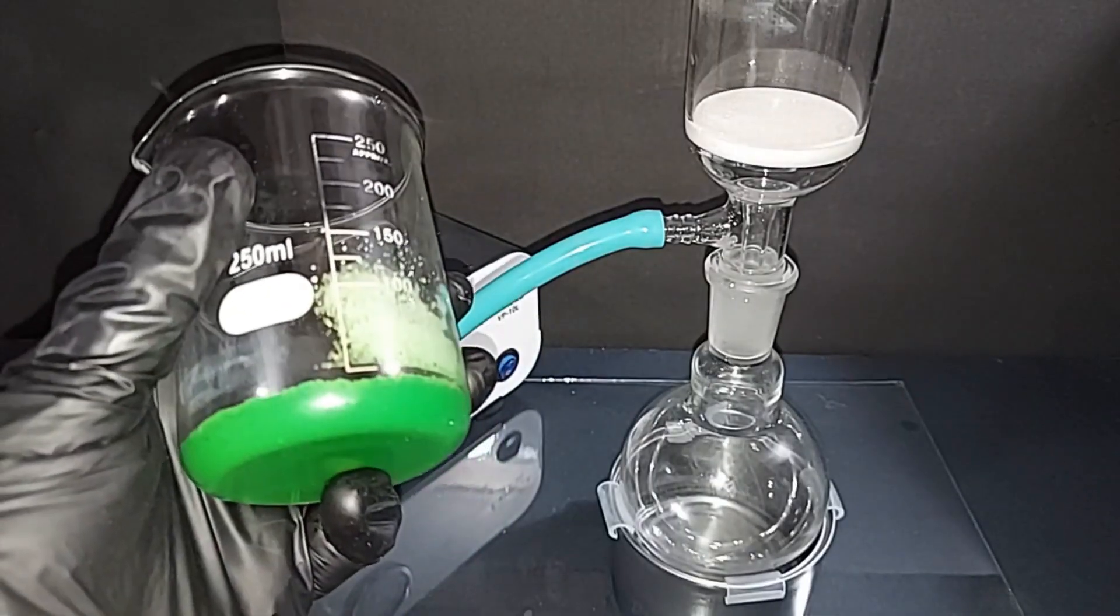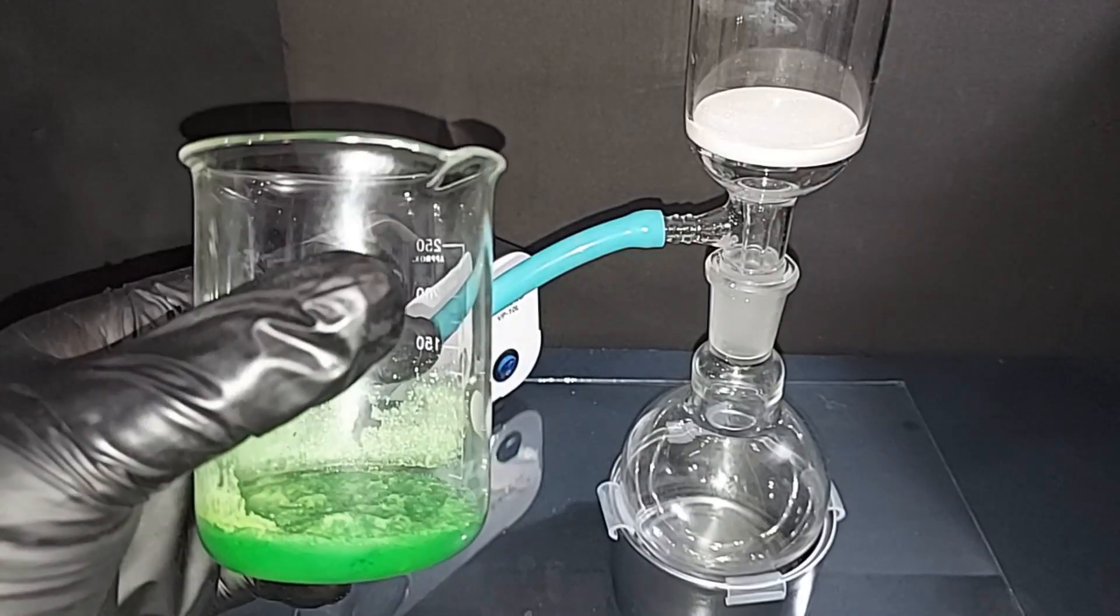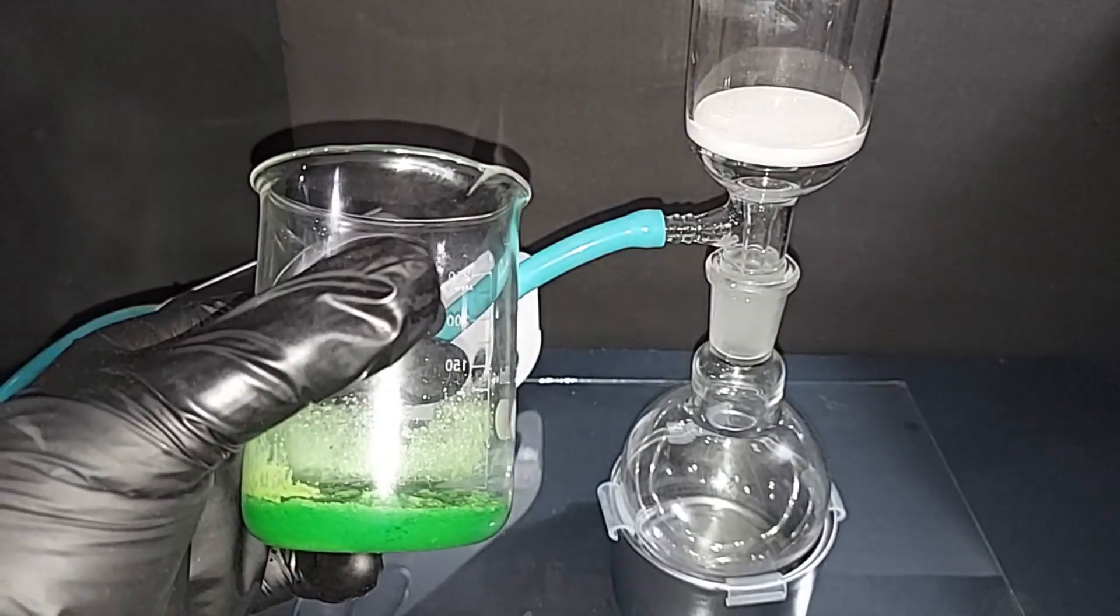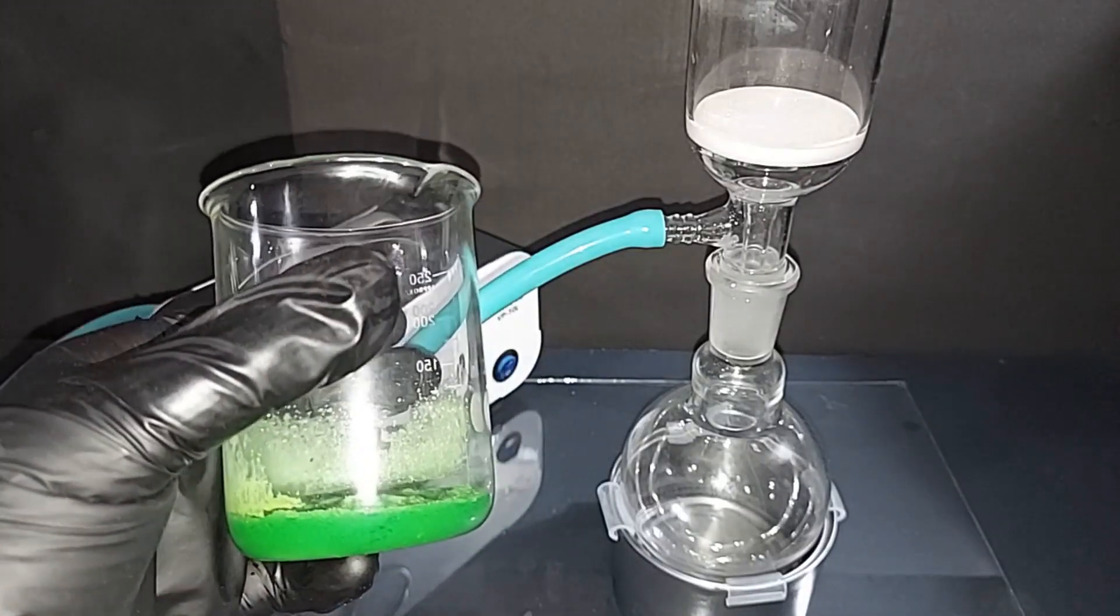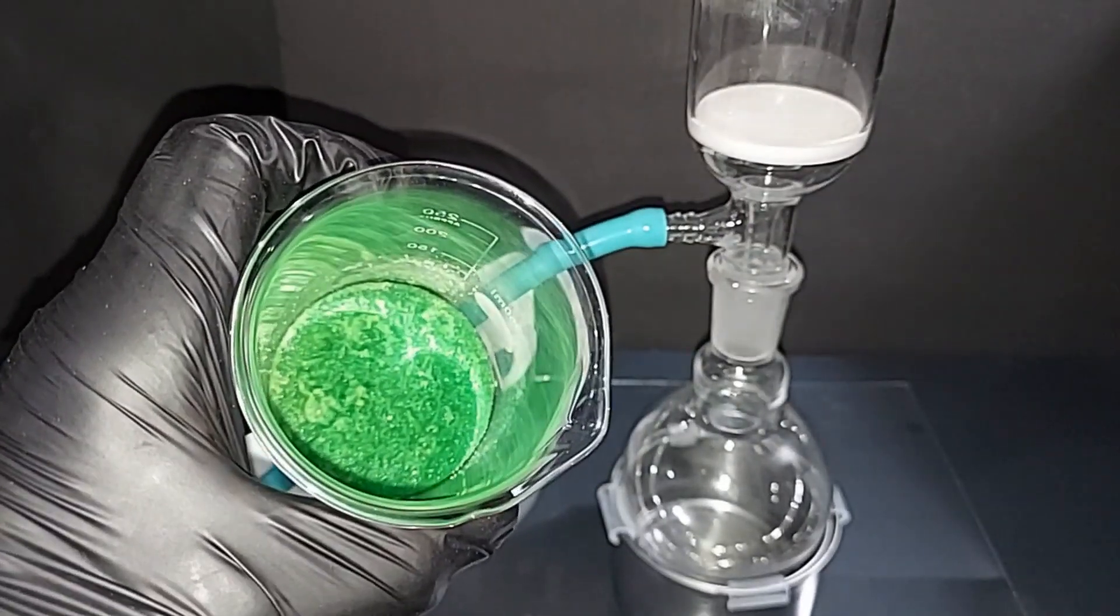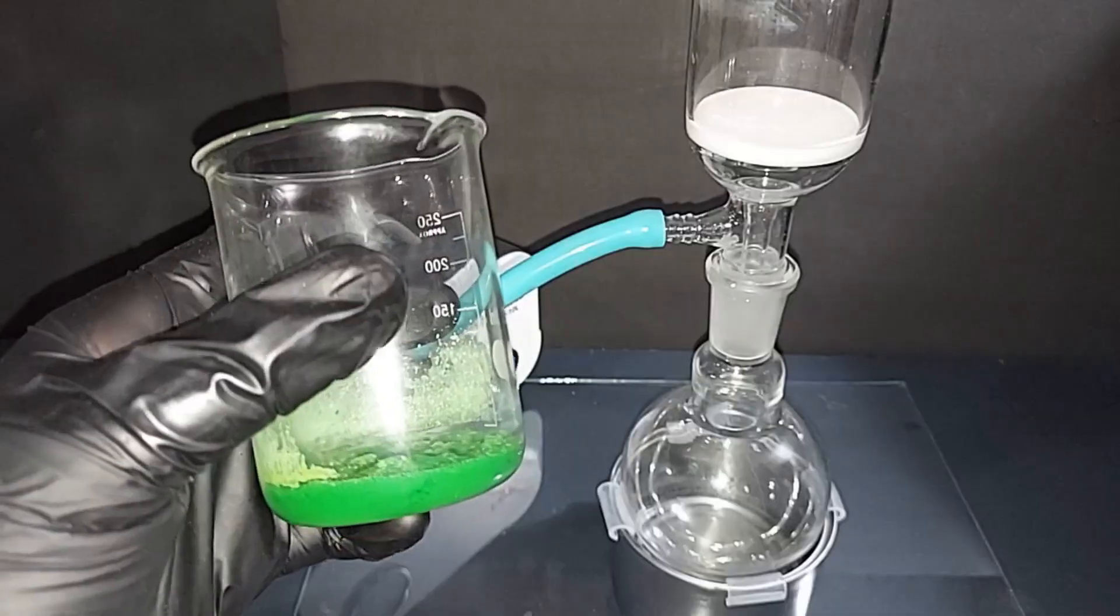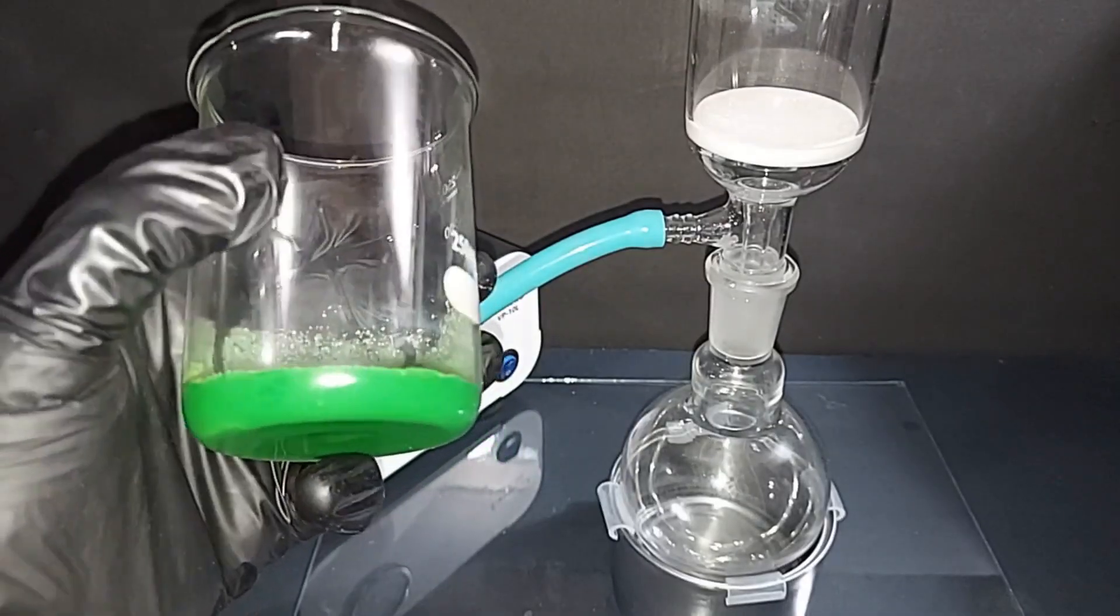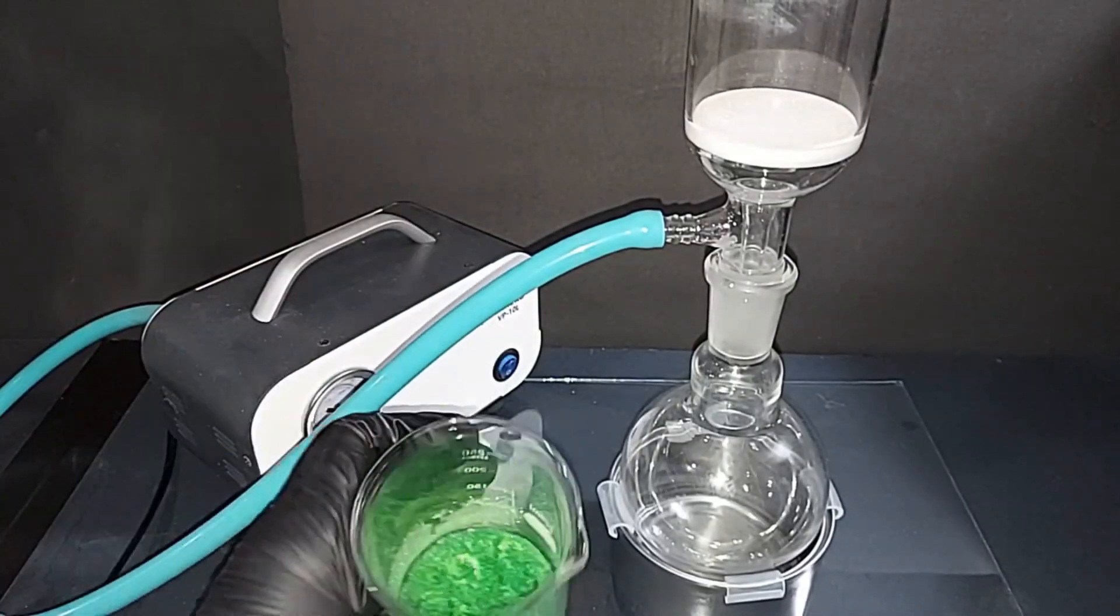So it had about 50 milliliters, there's probably about 25 in here just to give you an estimate. I got rid of about half of what was in there before it actually started to crystallize nicely like this. So I'm going to chip this out of here and then we'll filter it. I do want to wash it a bit to get rid of any excess hydrochloric acid especially.